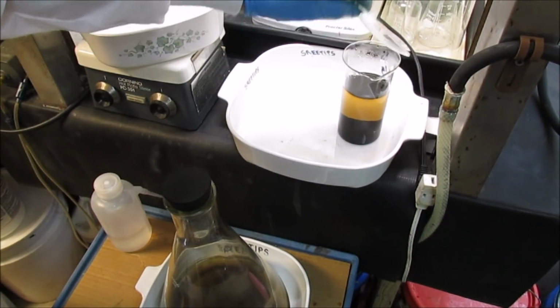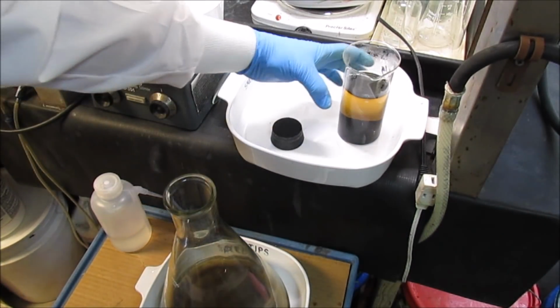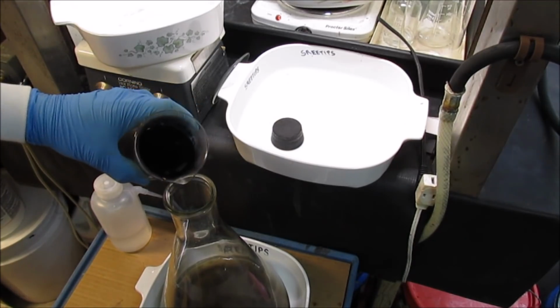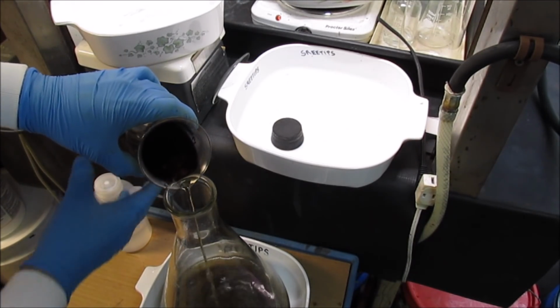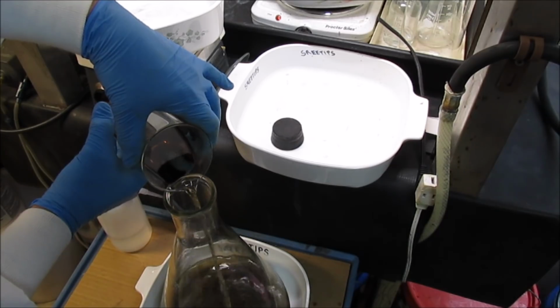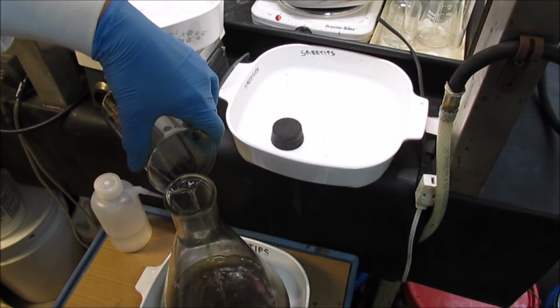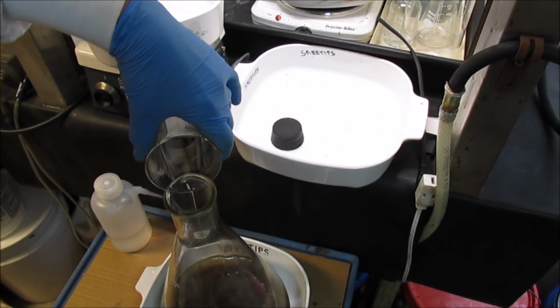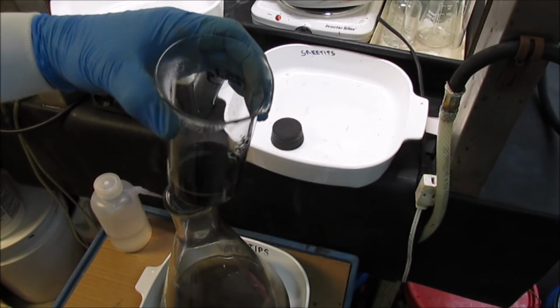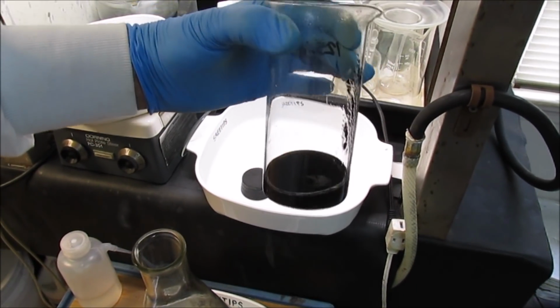That solution is still kind of warm, but the powders are nice and fluffy now, and they hold together well. So I think rather than using a vacuum to siphon this off, I can just pour this solution off into my waste container here without pouring the black PGM powders from the bottom of the beaker. And once I get this poured off, I'm going to start rinsing it with some hot distilled water until I get all the waste solution rinsed off of there. It's looking good.